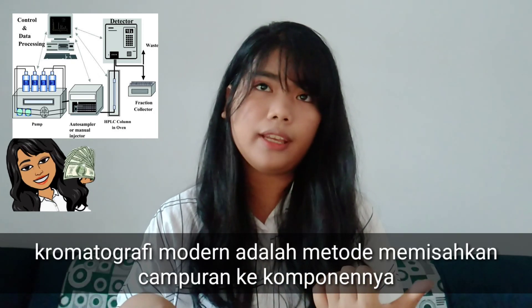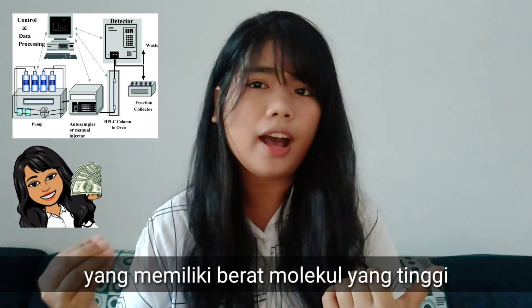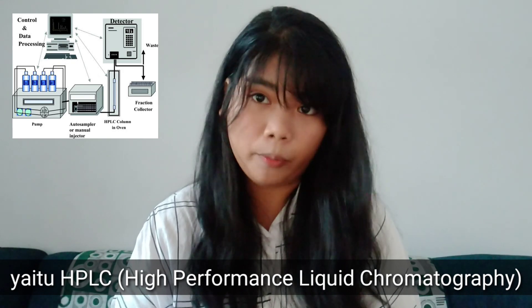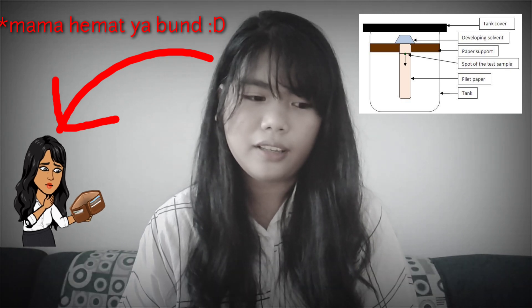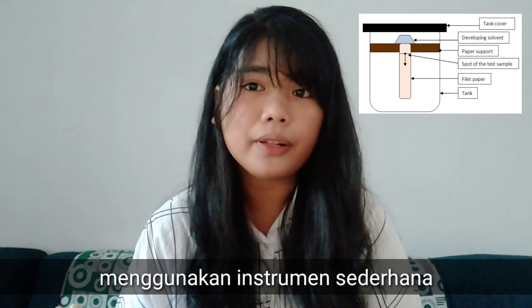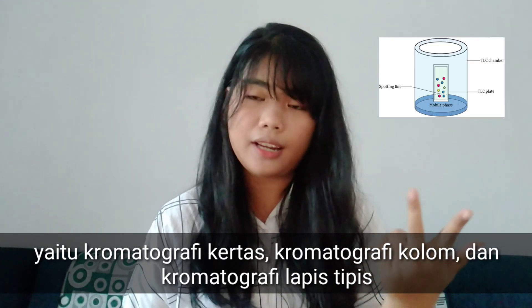Chromatography consists of modern chromatography and conventional chromatography. Modern chromatography is a method of separating a mixture into its components that have high molecular weight, using sophisticated instruments such as HPLC (High Performance Liquid Chromatography) or GC-MS (Gas Chromatography–Mass Spectrometry). Conventional chromatography uses simpler instruments: paper chromatography, column chromatography, and thin layer chromatography.